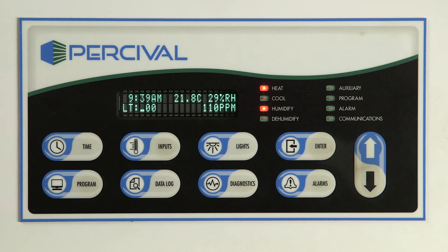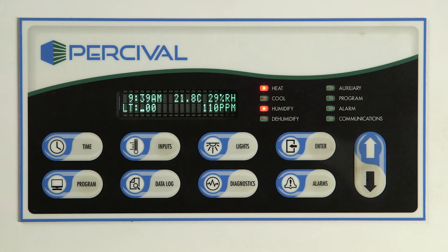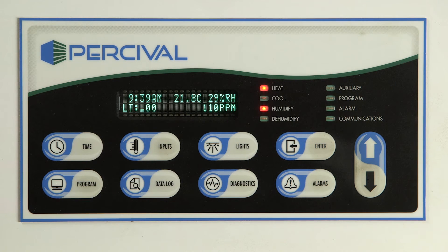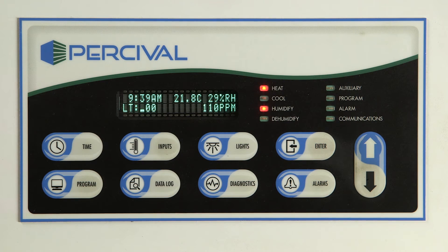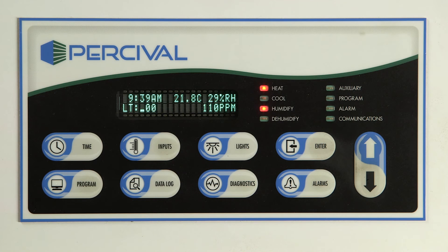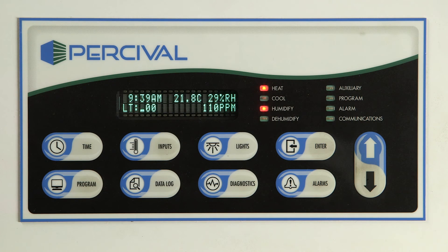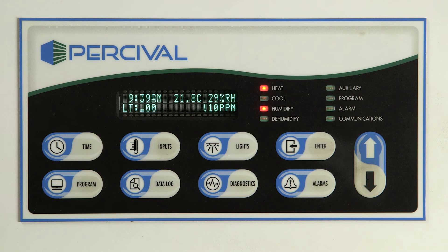2. 24-hour ramping mode will gradually increase or decrease between any two set points for a set period of time. For example, if you wish to mimic temperature increase or decrease throughout the day. 3. and 4. Elapsed programming allows you to set a program shorter or longer than 24 hours. You can do this in both ramping and non-ramping modes.